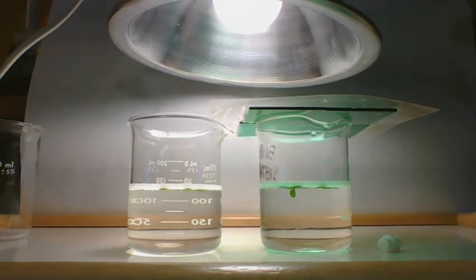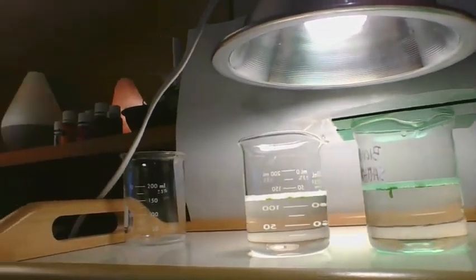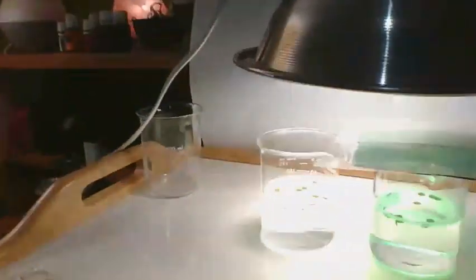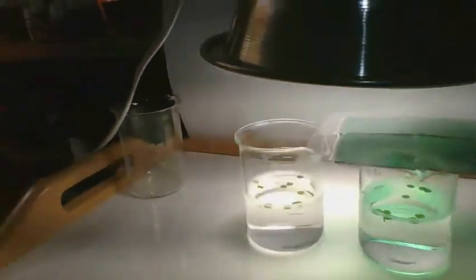At this point, we have 10 floating on either side, on both white light and green light. You can see them floating there if I aim the camera down a little bit. It's a struggle with this camera. I'm going to stop this video now, and your responsibility is to finish up the assignment, move on to the next section, and do what you need to do. Good job, guys.